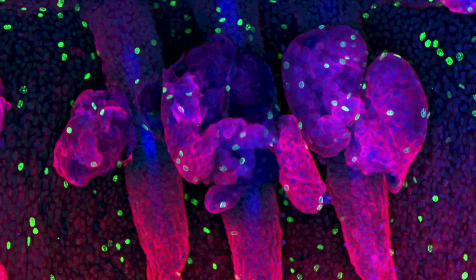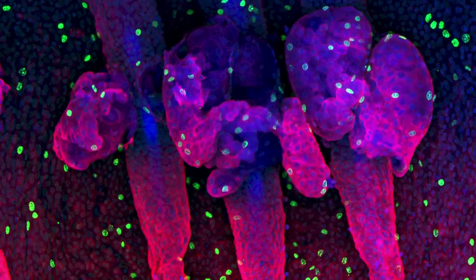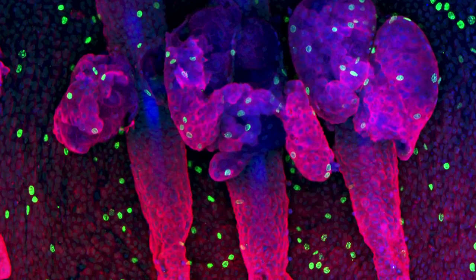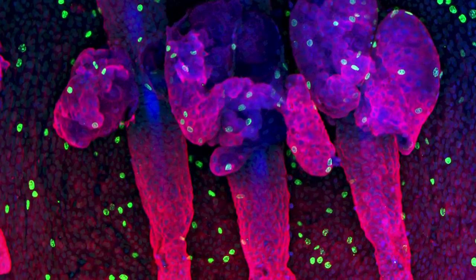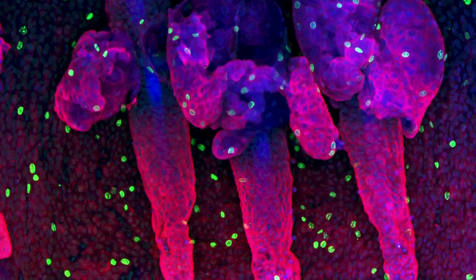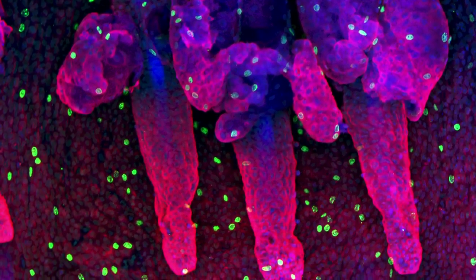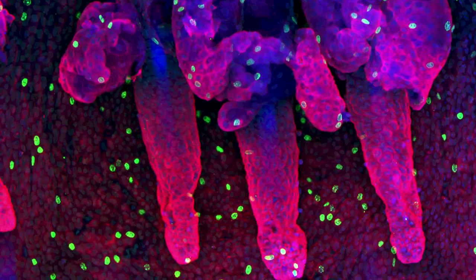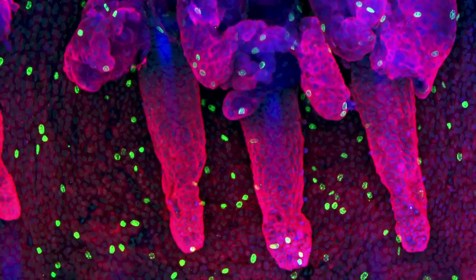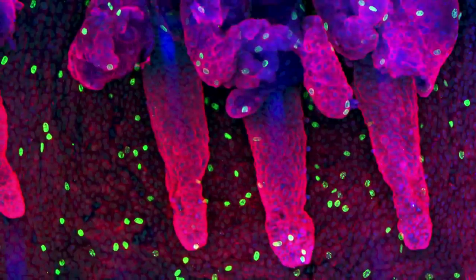Hi, my name is Claire Cox. Here we can see underneath the outer layer of skin of a mouse tail. This outer layer is made up of many different types of cells. The red cells in the background are the skin cells, and in front of them we can see the hair cells grouped together. The nuclei of each cell, which contains the DNA of the cells, is shown in blue.